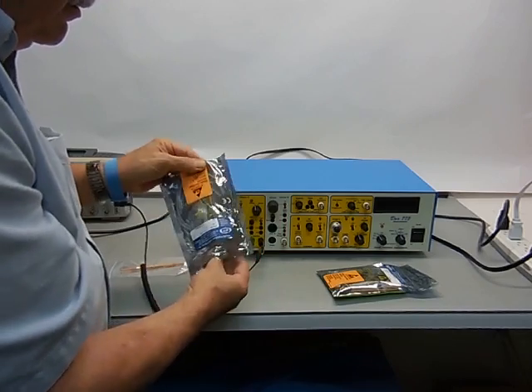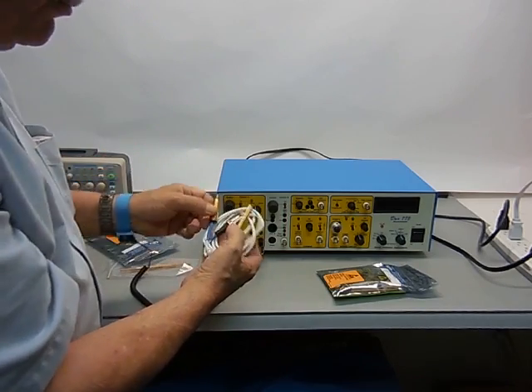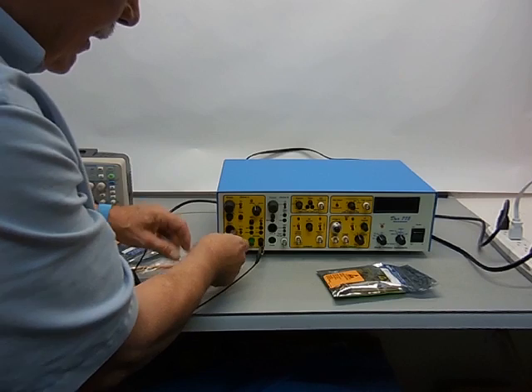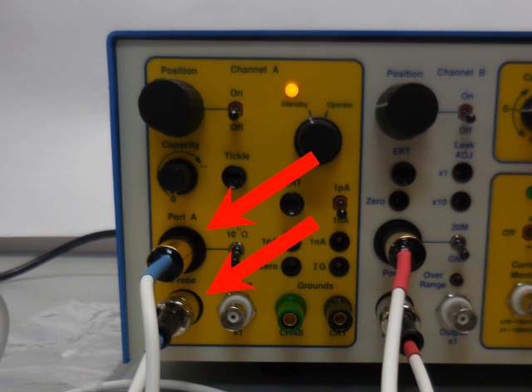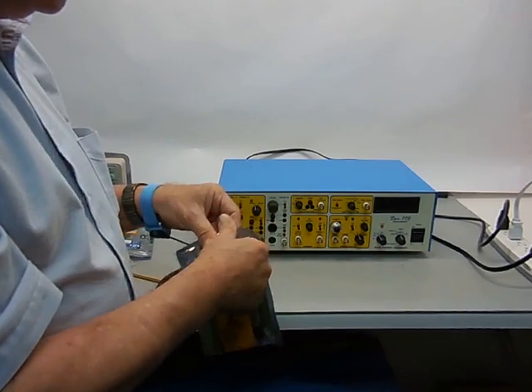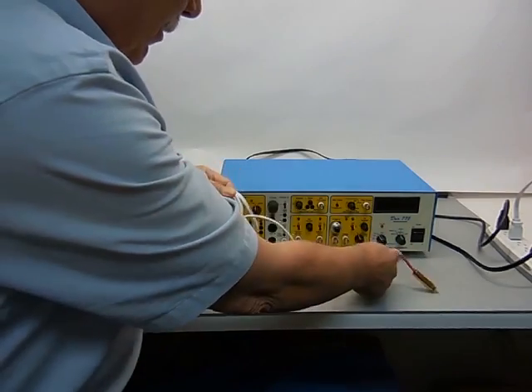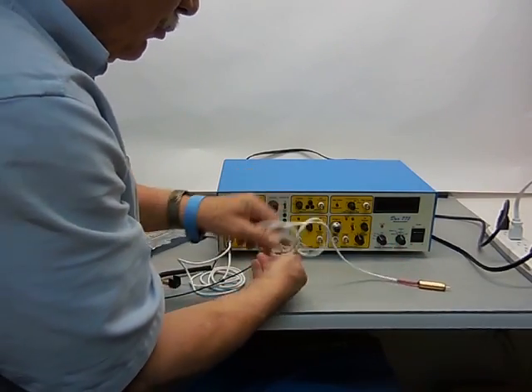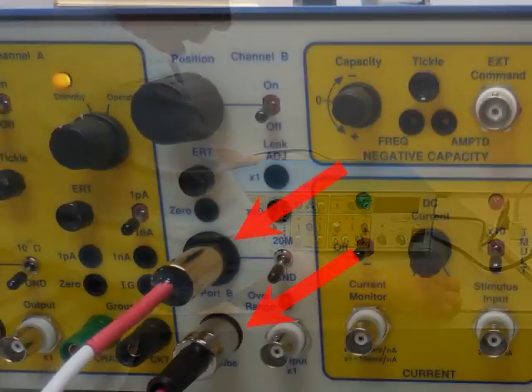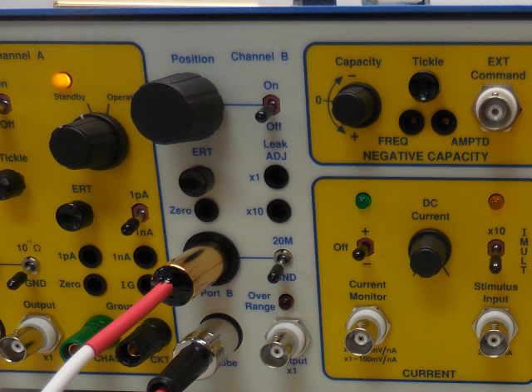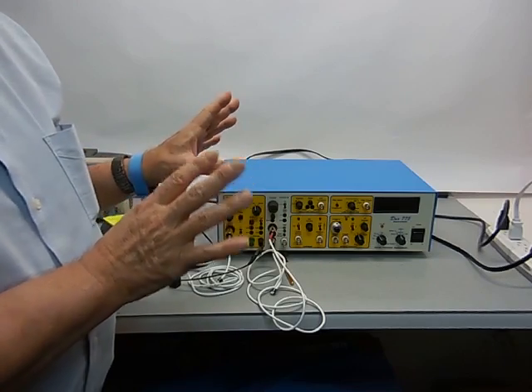I'm going to unpack the 715 probe, which is blue. It plugs into Port A here and make sure it's switched to ground. This is the normal storage condition for these probes - they're plugged into the chassis and grounded. The B probe is red. You plug it in and connect it to the B port and switch to ground. This is the normal storage condition when you're not using the amplifier and the initial setup conditions for tweaking up the amplifier.